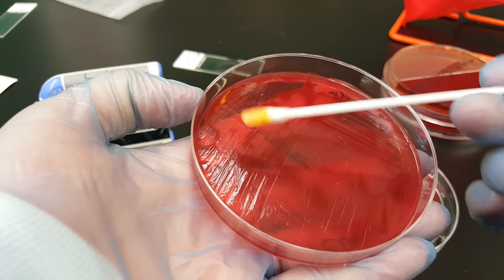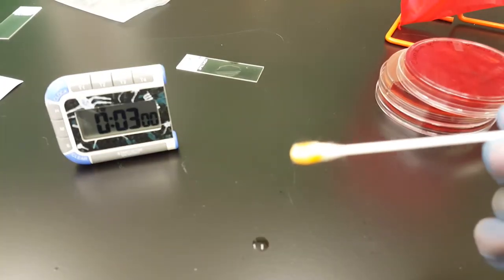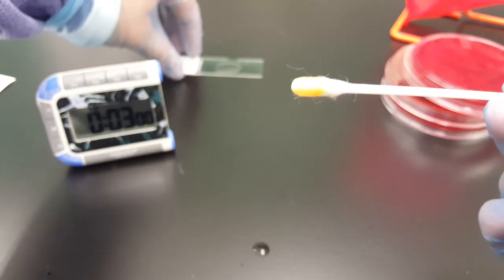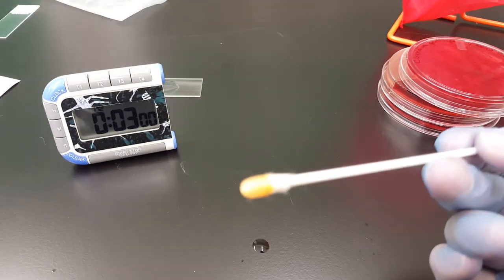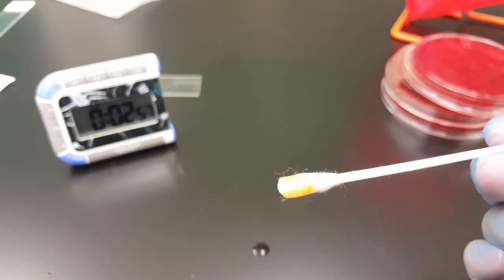Let's touch the colony. We've got some on there. And we're waiting for a purple color. All right, start the timer. And we'll get back to you.